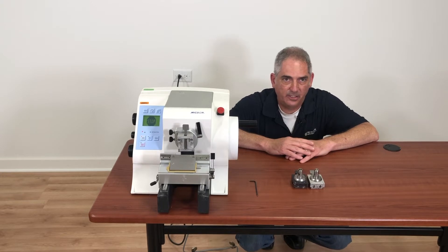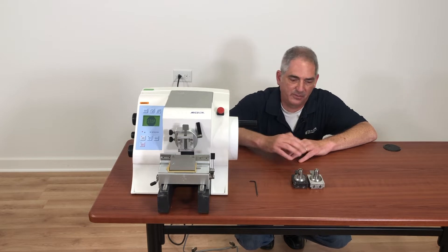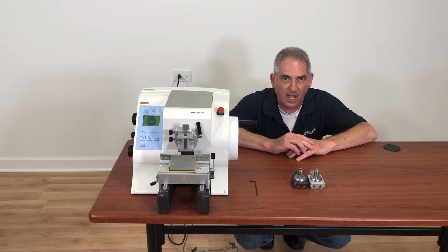I was originally thinking I was going to do one single video on cassette clamps, but my rule of thumb for this series is to keep all the videos under five minutes. The more I thought about the cassette clamp, the more I realized there are so many little things that can go wrong on them, there'd be no way I'd be able to cover it in five minutes. So I've divided it up into sections, and this first section is about what to do if your specimen orientation lever won't lock.